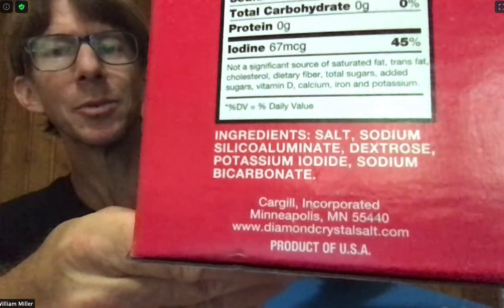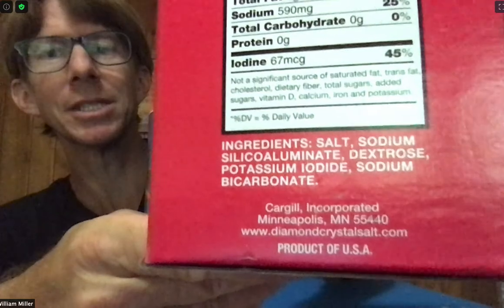I've got two types of salt here. If this were in a chemistry lab we would use 99.9 percent pure sodium chloride. We're going to be using sodium chloride or salt over the counter, and I've got two different kinds: sea salt coarse and iodized salt. Effectively, if you use table salt of any kind it will work for this experiment. Table salt includes more than just salt — very low percentages of other materials — but it is definitely 99 percent sodium chloride or higher. Those are just small additives.